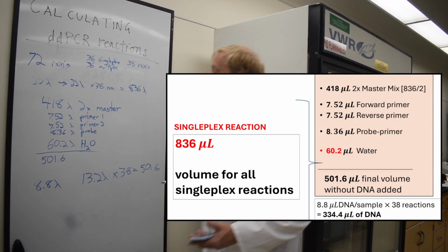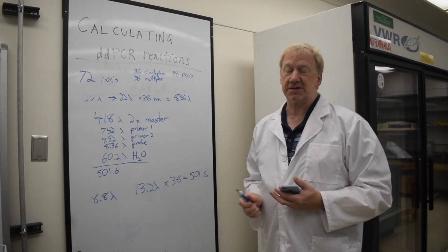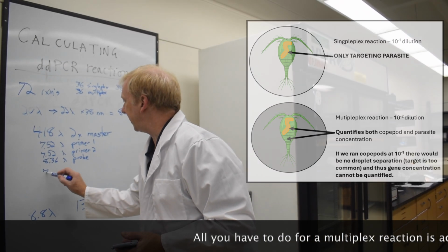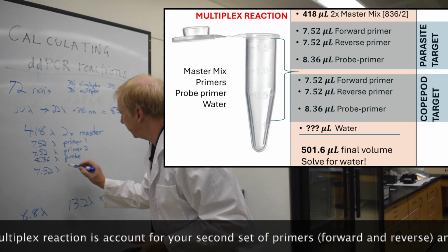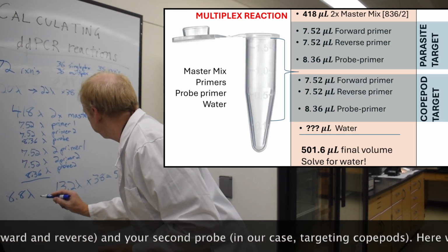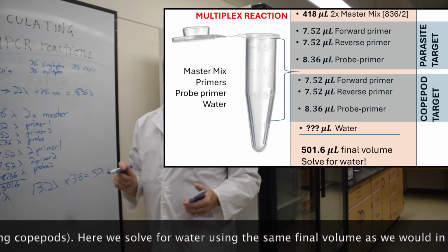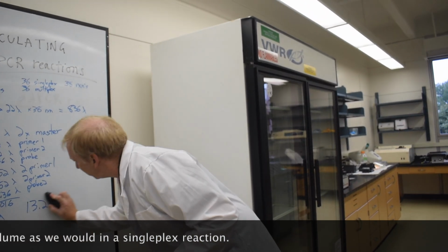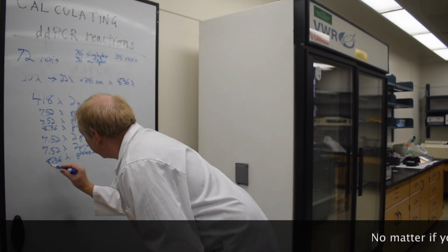Then water. Okay, so now let us calculate our reaction mix for the multiplex reaction. So we need 7.52 microliters of our second primer 2 and our second primer 1. So can all of these different primers and different probes exist within the same reaction? They not only can, but they must. That is the beautiful process of ddPCR.